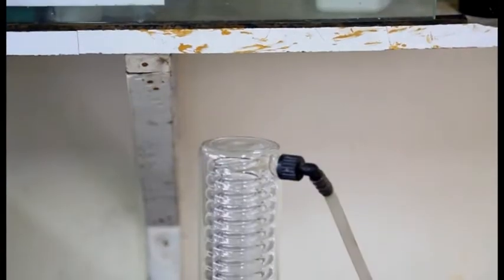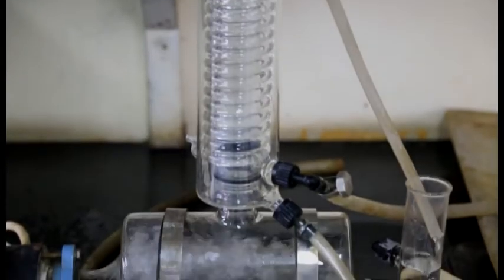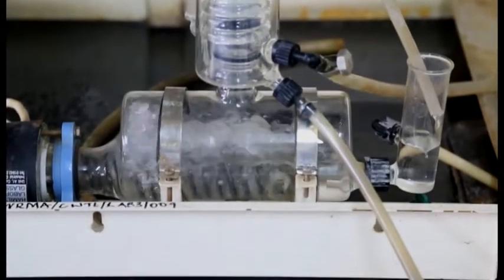For example, for discharges to get permits from WRMA, it is required that they submit laboratory results. So in such cases, the Central Water Testing Lab comes in to help such clients get to know the quality of their effluents.